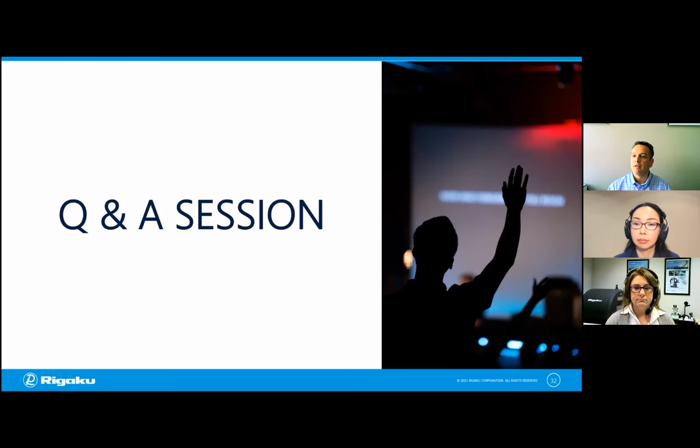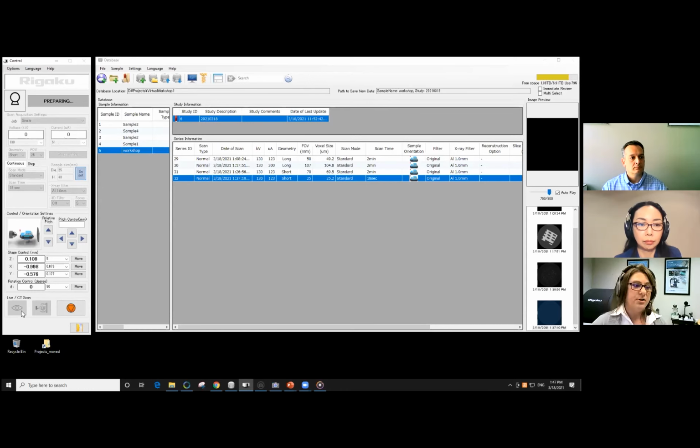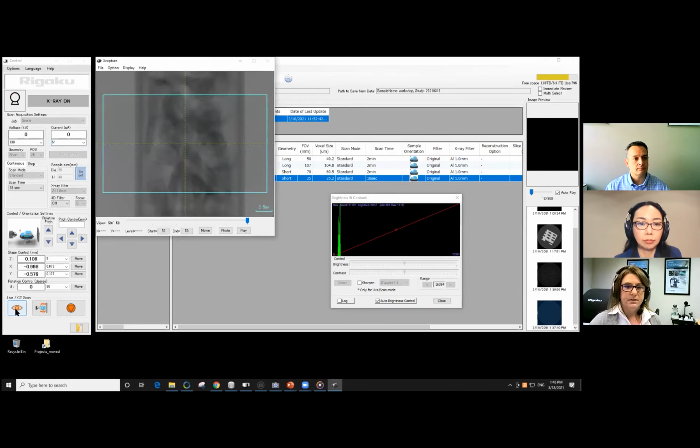There's another question: how did you fix the kV? So that's simply the pull-downs, correct? Within the software? Right. I can just show you that. So here are the different settings. And as a consequence, if I change the focus, say, to small, and I'm using a large voltage and I open the shutter, then it's going to adjust down the current so that we don't melt our target material. So it's intelligent. It knows what it needs to do in those cases. But yeah, it's just a drop-down choice.